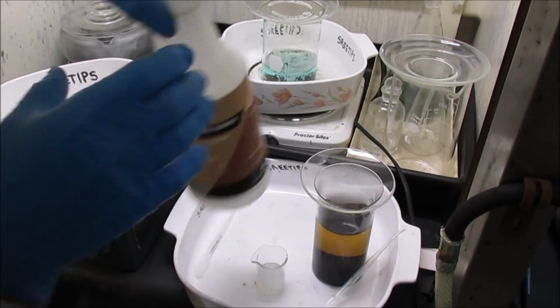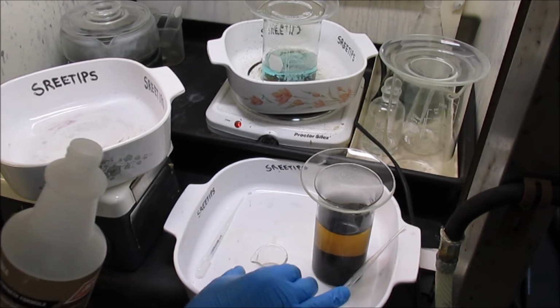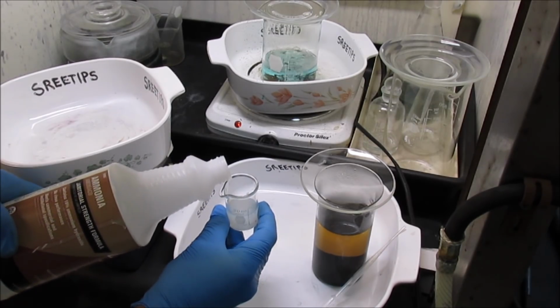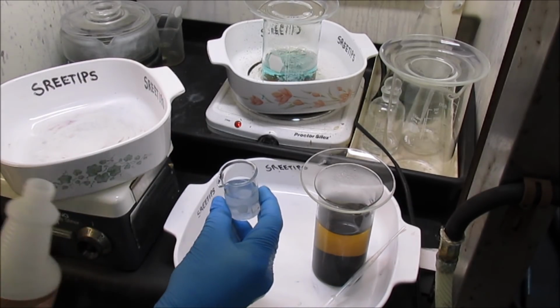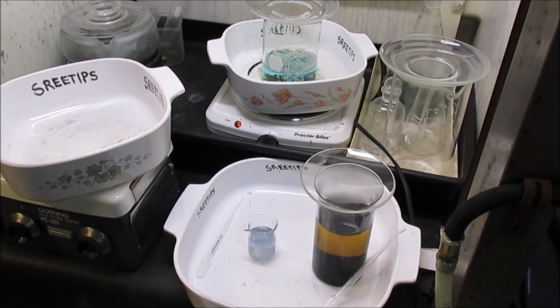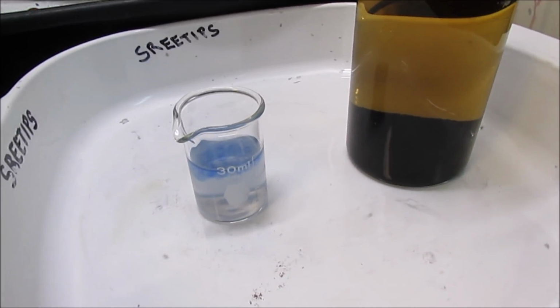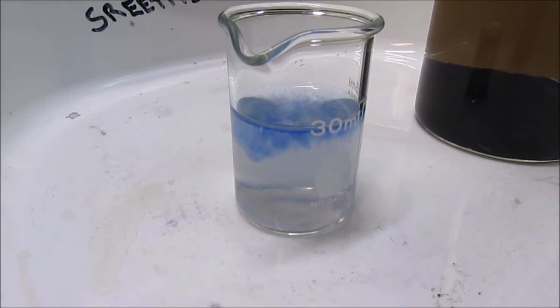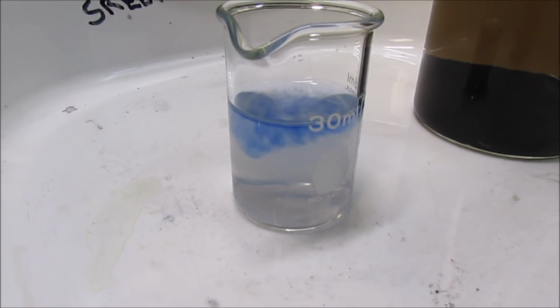I'm going to add right out of the bottle here. I do see some blue color going on in there. I'm going to add a little bit more of this ammonia. Oh yeah, see that? That blue color is an indication of copper in solution. That hydrochloric acid boil appears to have produced a good result here. That blue color in that test solution indicates I've got copper in solution, which is what I was after.